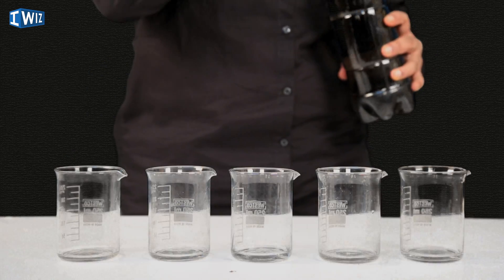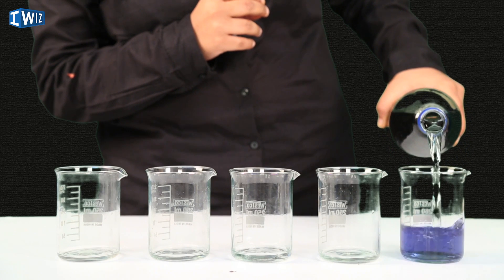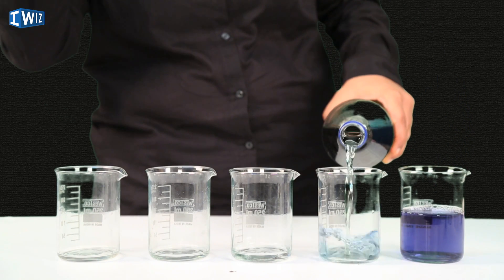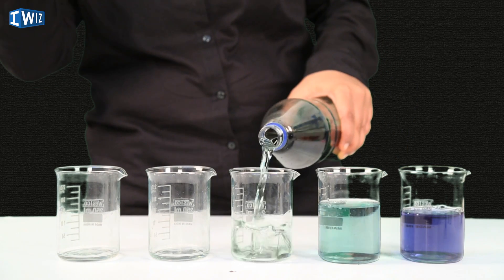Before we delve into the chapter, I wanted to show you a really neat science trick with some magic water and these beakers. The magic water is going to change colors from one to two to three.